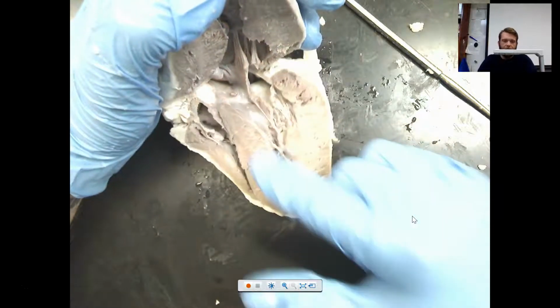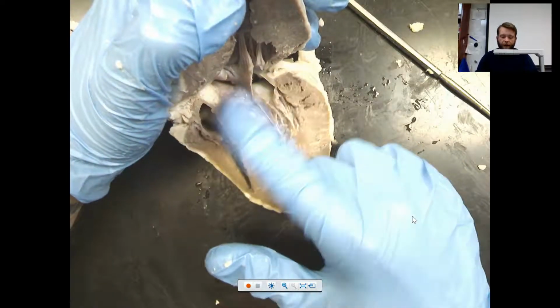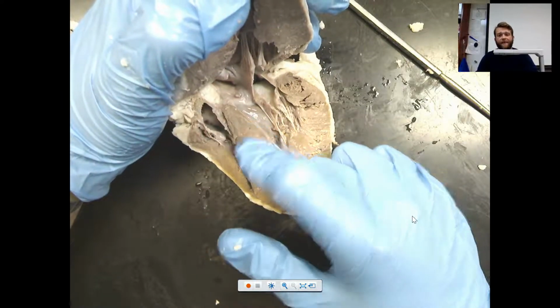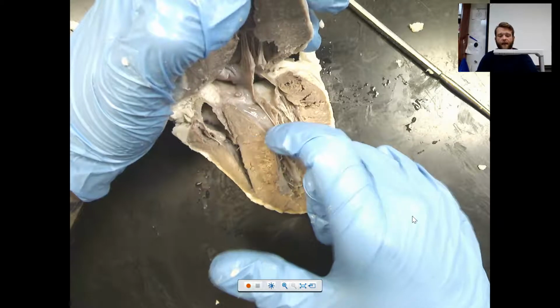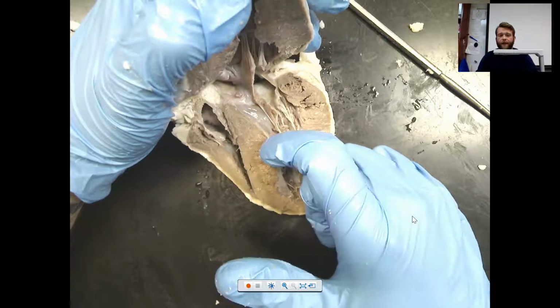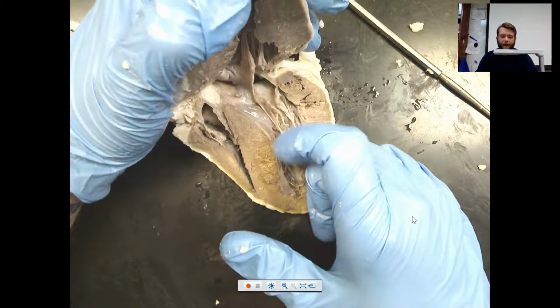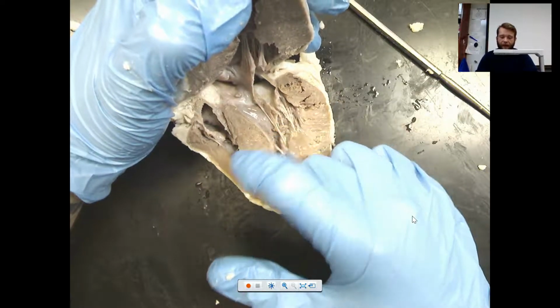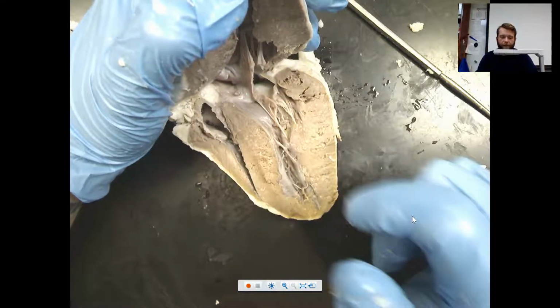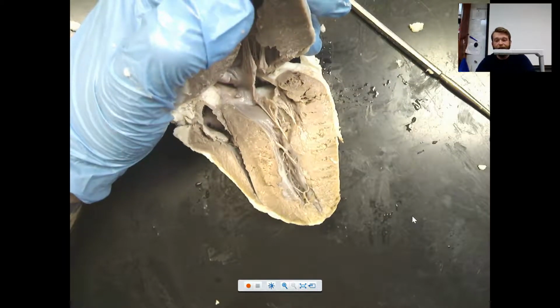This is the septum. The septum of the heart is separating your ventricles and atria from each other, so the two sides from each other. If you hear about hole in the heart or congenital birth defects, oftentimes it's because there is a hole that exists right here. That's because of the circuit that exists in fetuses when they're receiving blood and nutrients from the mother. It actually bypasses part of the heart and gets carried through in a different pathway. Because of that, we'll end up with improper fusing of the septum here, so you'll see a hole between the ventricles sometimes. This heart, however, has none of those problems. This is a very healthy heart.